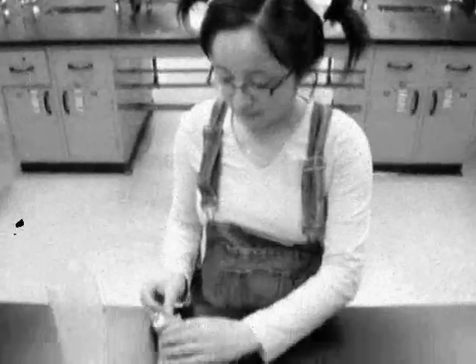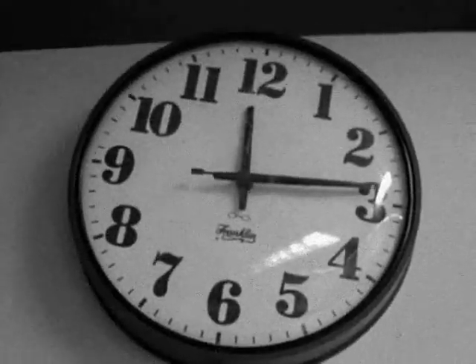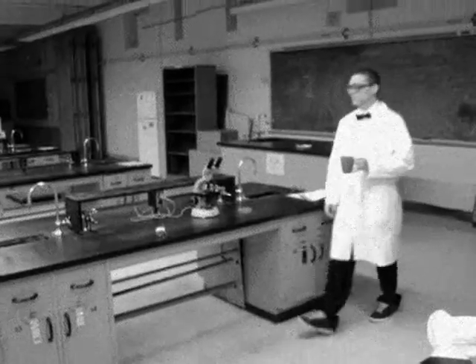And here's our friend Jane again, putting some bacteria on some yummy agar petri dishes. Look at them grow! There's the lunch bell. Those plates can wait until she's had a plate of her own.